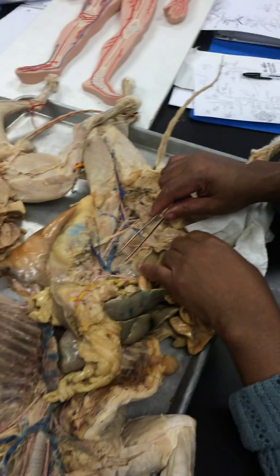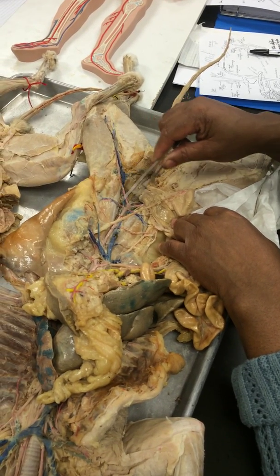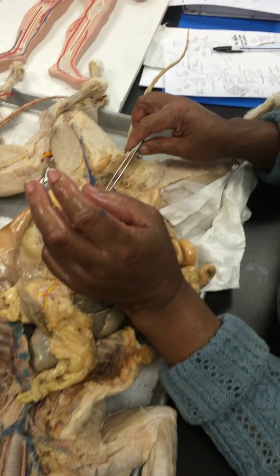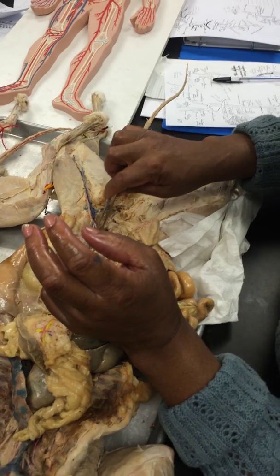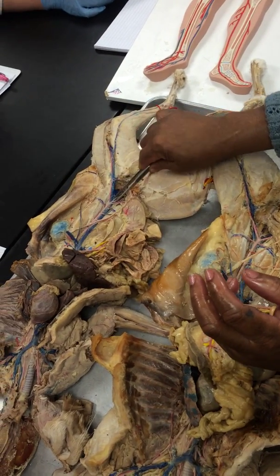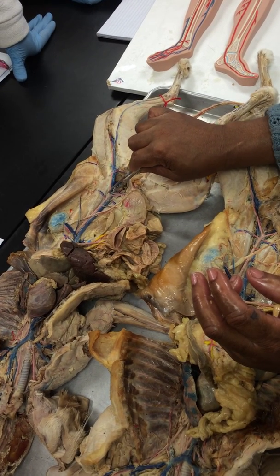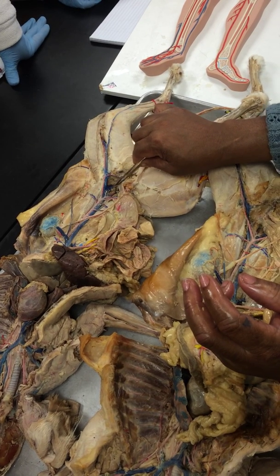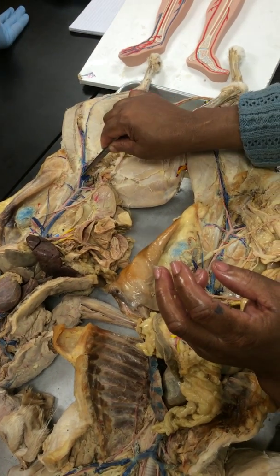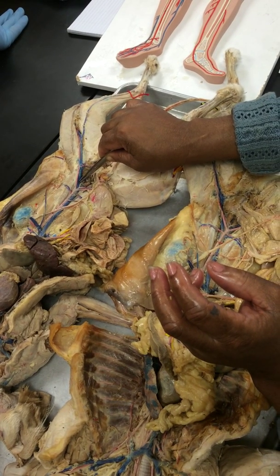Come on down, and the next branches are these ones that match the iliolumbar at the bottom, and then it branches into a Y, and I think you can see it a little better on this cat. So there's the Y, and from the first time it branched to where it branches right here, between here and here, that's the common iliac vein.